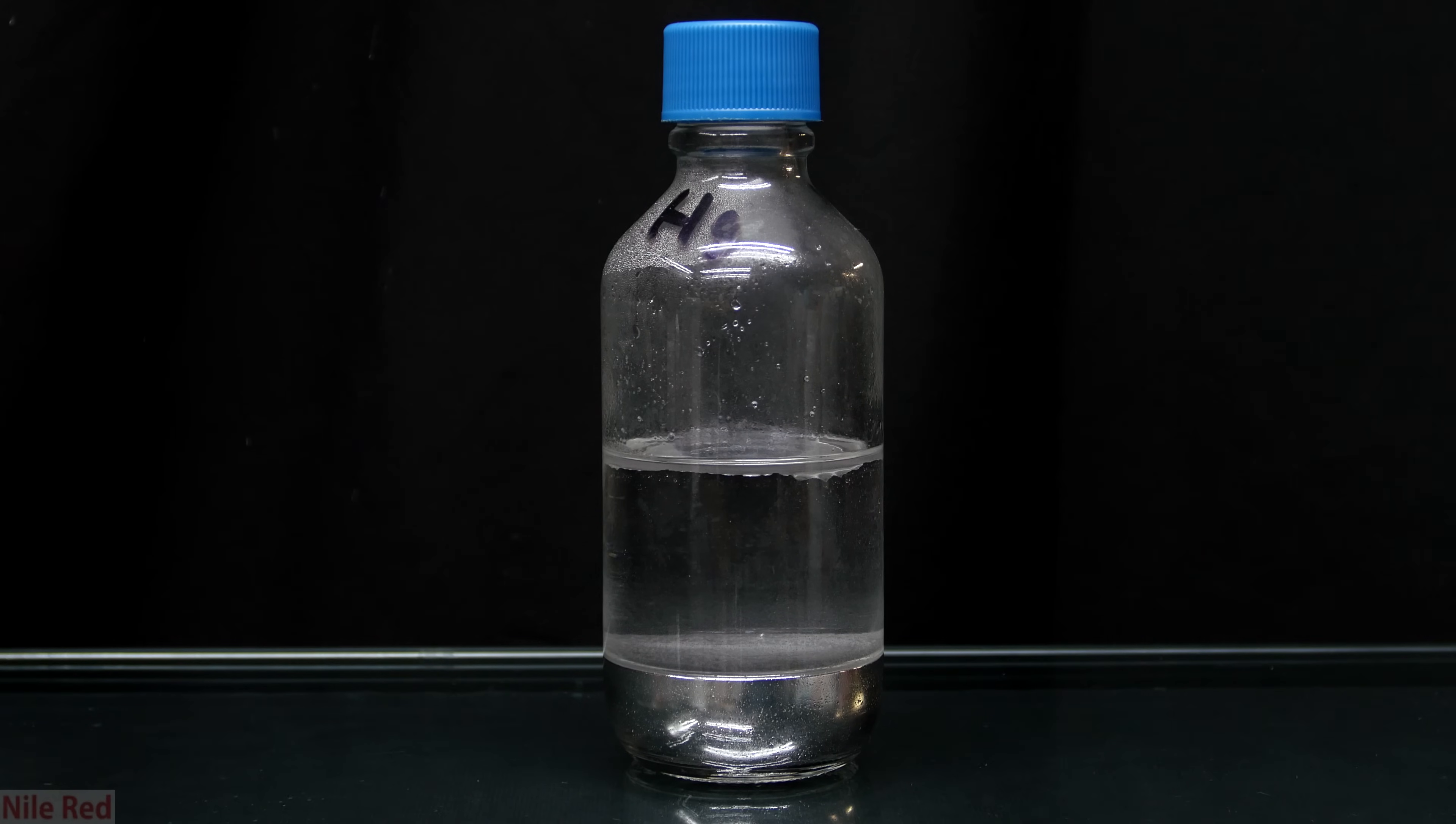So here's the mercury that I need to clean up. Above it there's a large layer of water to keep the mercury vapors down. Unfortunately I got my mercury from various different sources where some was stored under oil and some was stored under water. I like to store mercury under water because then I don't have oil contamination when I use it in a reaction.